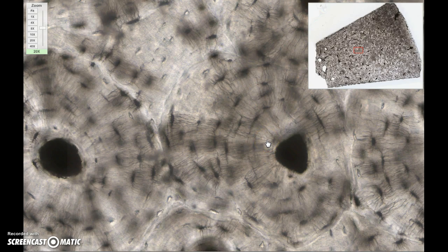matrix, and that's just not going to be able to happen. And so we have these little channels, the canaliculi, that go from the central canal to one lacunae, then through a canaliculi to another lacunae, and then to the next one. And you can see how then we can get all the way out to these outer cells here.